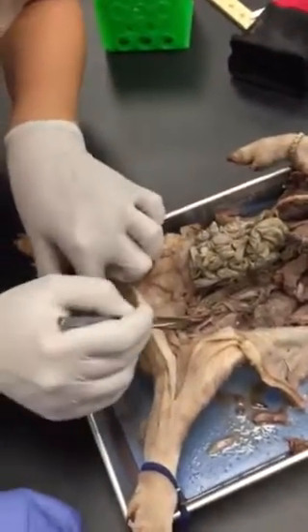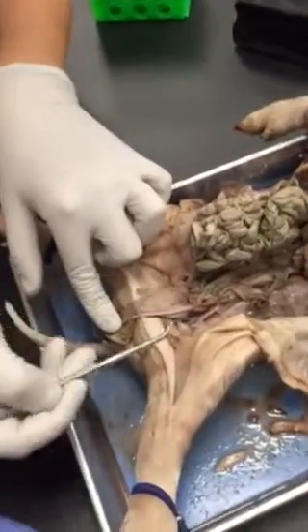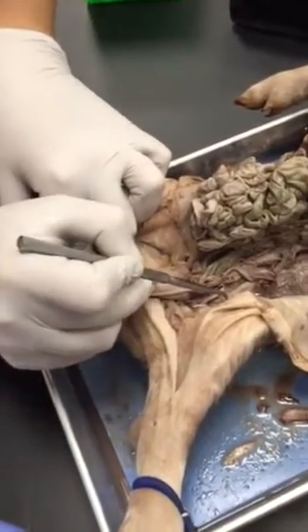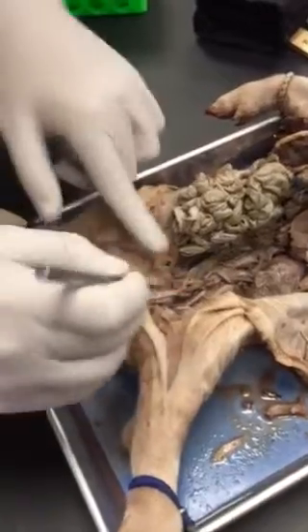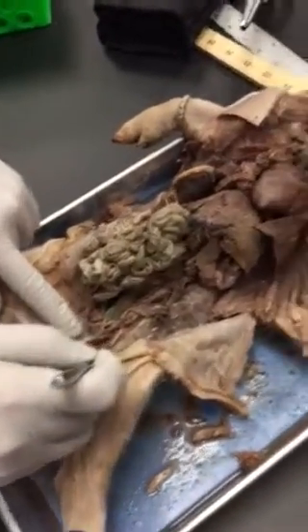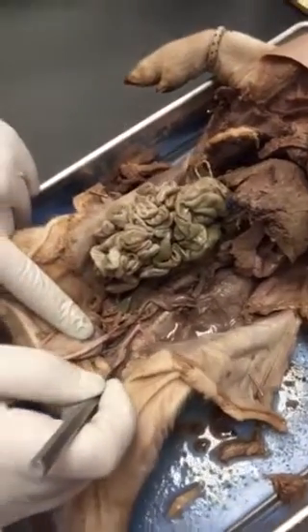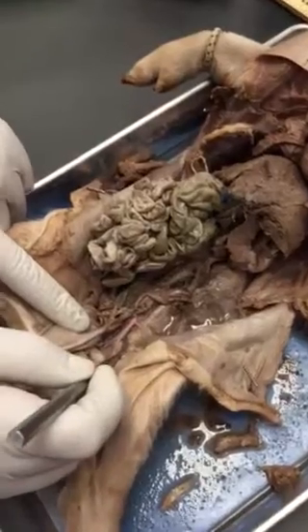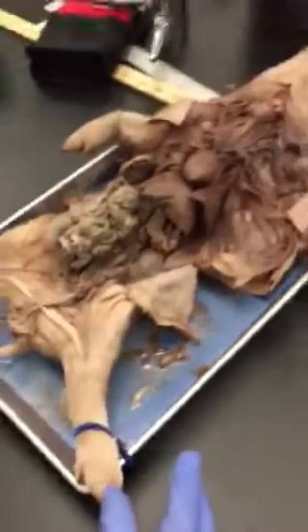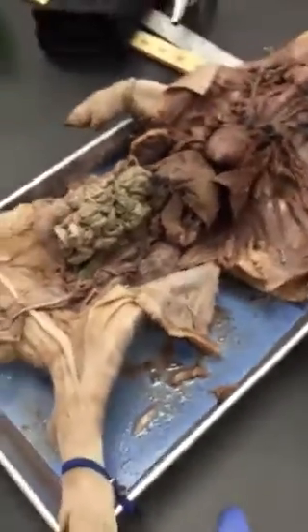So, okay, umbilical artery, deep femoral artery goes right into this inner part of the thigh. You have your internal iliac and your external iliac. Okay? And if you look behind it, you see you have the same things in veins as well. So you also have deep femoral vein, internal iliac vein, external iliac vein. Okay? You guys all good with that? So these are going to serve as really good study guides for you to figure out what's what. Okay? Did that help? Yes.